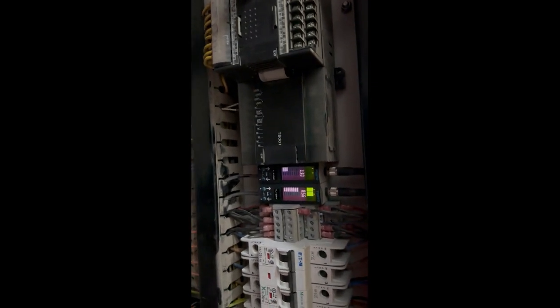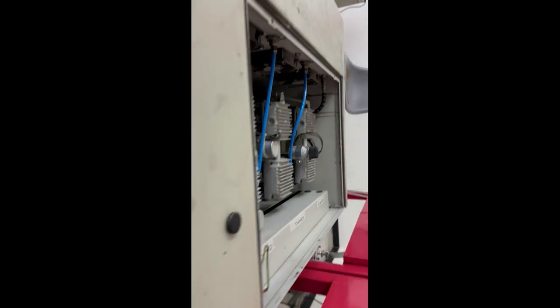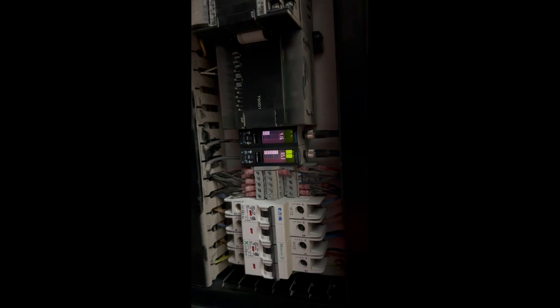I have already diagnosed the problem. The problem is with the leakages, and although the system is right now in normal mode with some minor faults, it can be used. So for right now we have to confirm the working and the health of the compressors, so then we would be able to claim what the problem was and how we can rectify it.